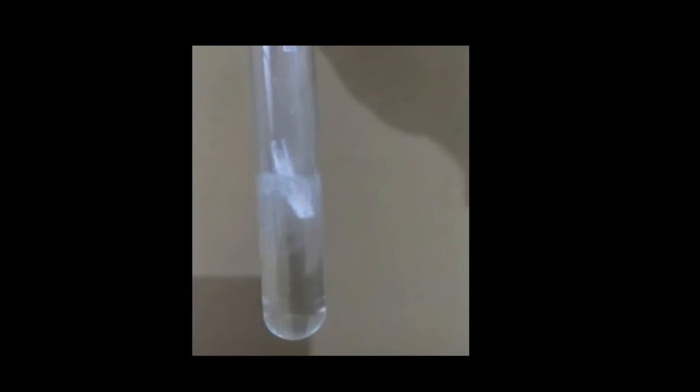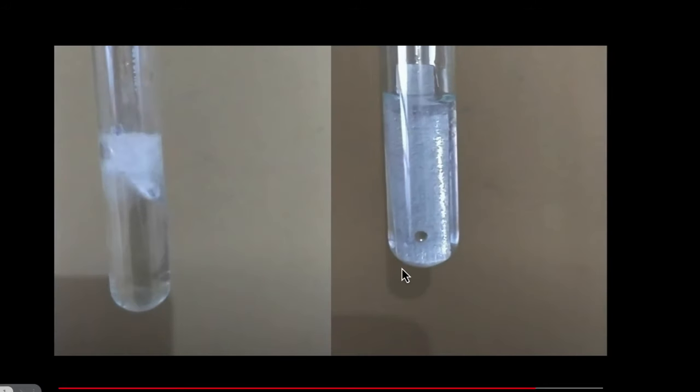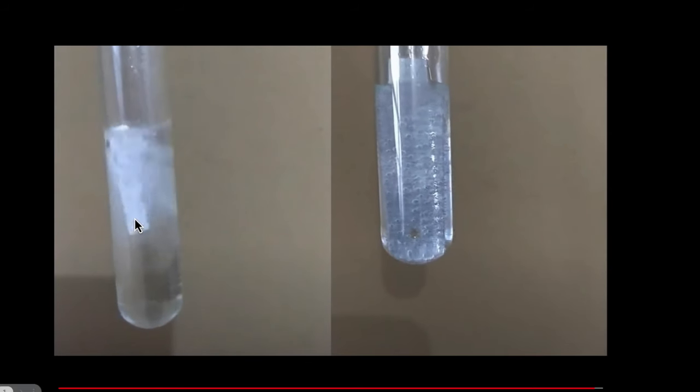We again see bubbles. But wait, this time the reaction looks much more vigorous than before. If you compare the two, this is with the zinc, this is with the magnesium, you can clearly see there's more vigorous reaction over here. So what is going on? What does it mean?